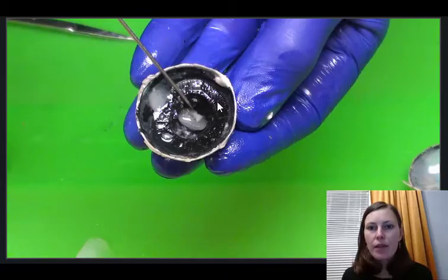And then we have the ciliary body that is right next to the iris here. And you might be able to see kind of all these little bright lines on the ciliary body. This is where the zonular fibers would be. And the lens that's connected to the zonular fibers was sitting right in this area right here before we removed it.